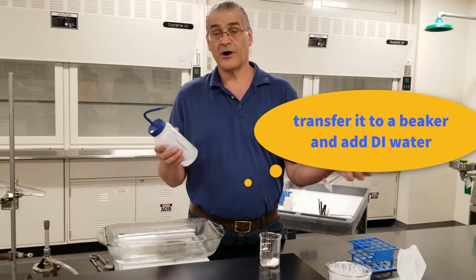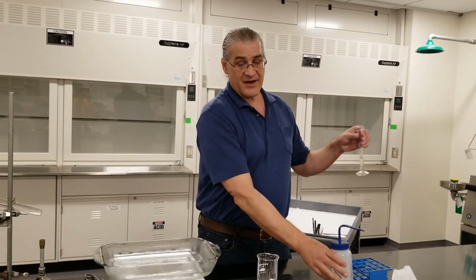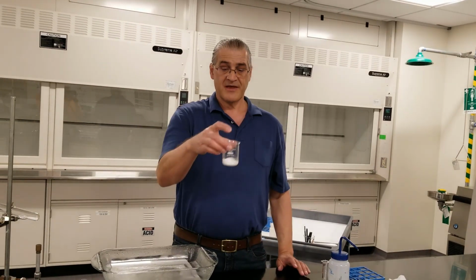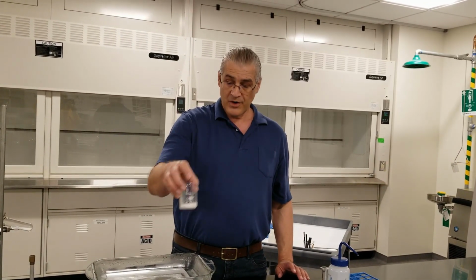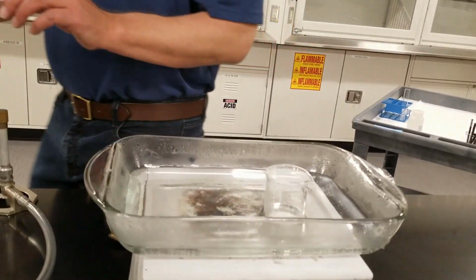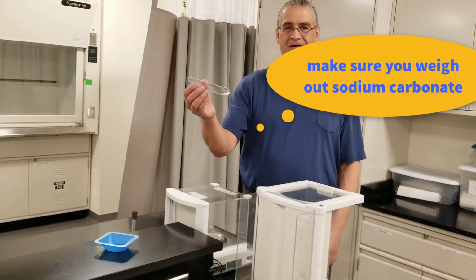We need to add some water. So the procedure says to add about 1 milliliter of water for every gram of the potassium bitartrate. It won't dissolve, it'll just kind of make a sludge. And there's our potassium bitartrate suspended in water. We heat it up by placing it in this hot water bath. And to get the reaction going, we have to add our sodium carbonate.